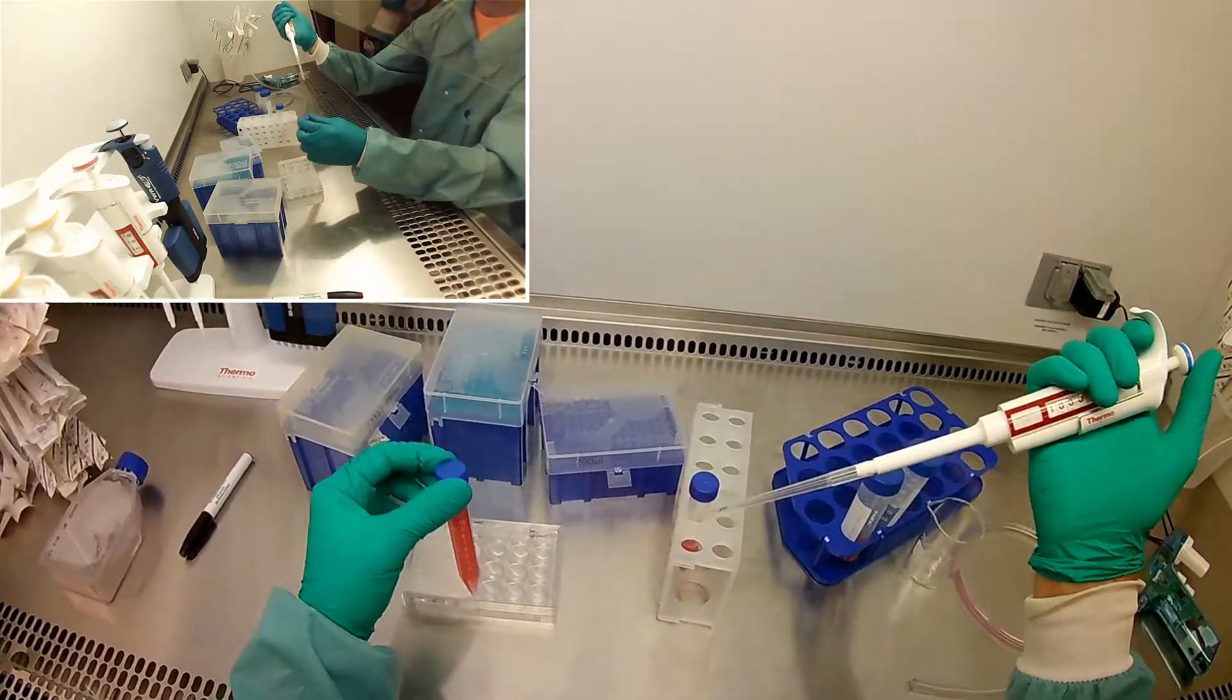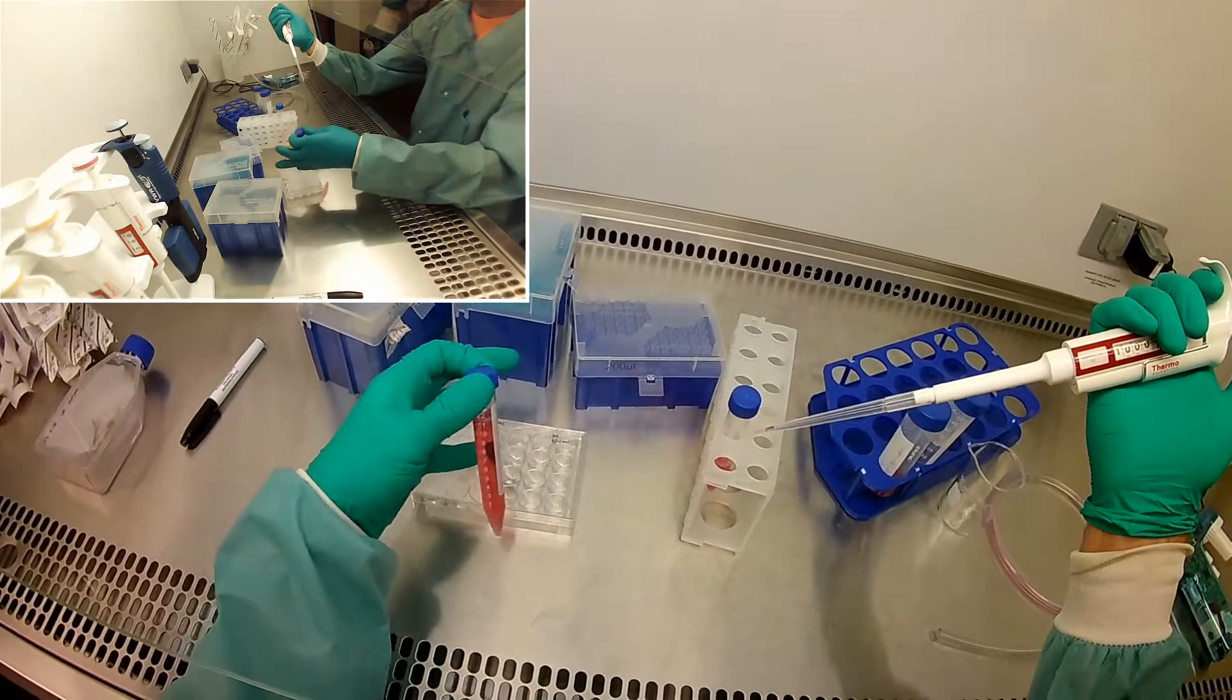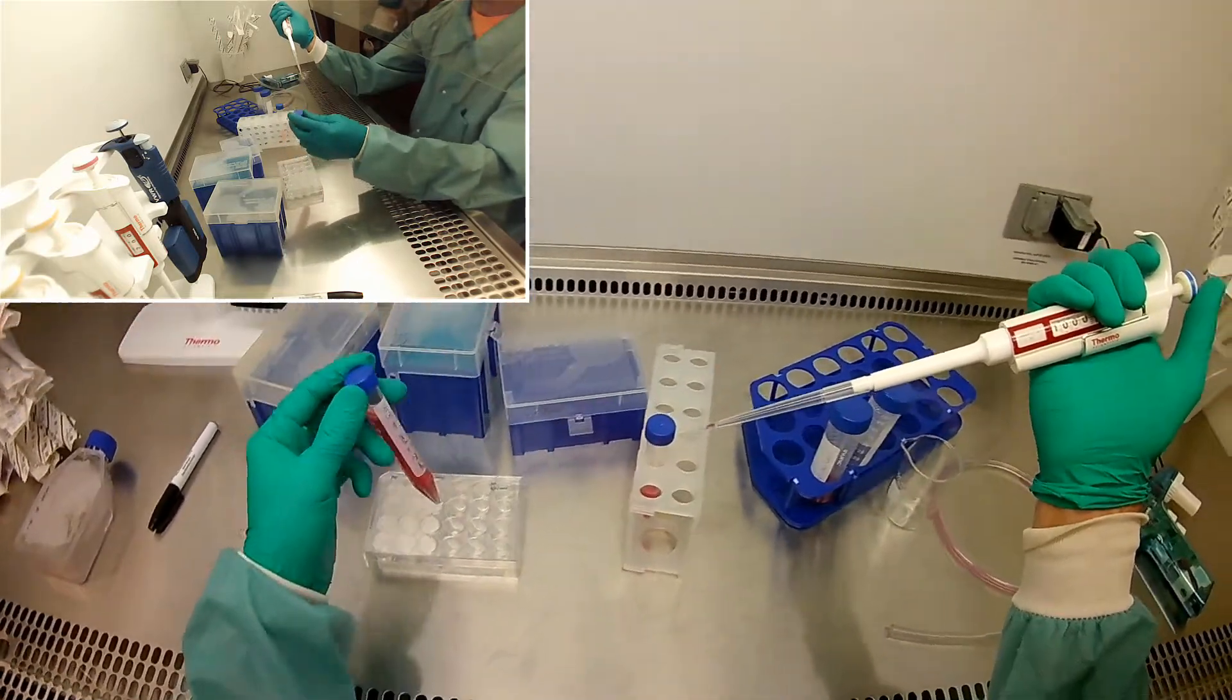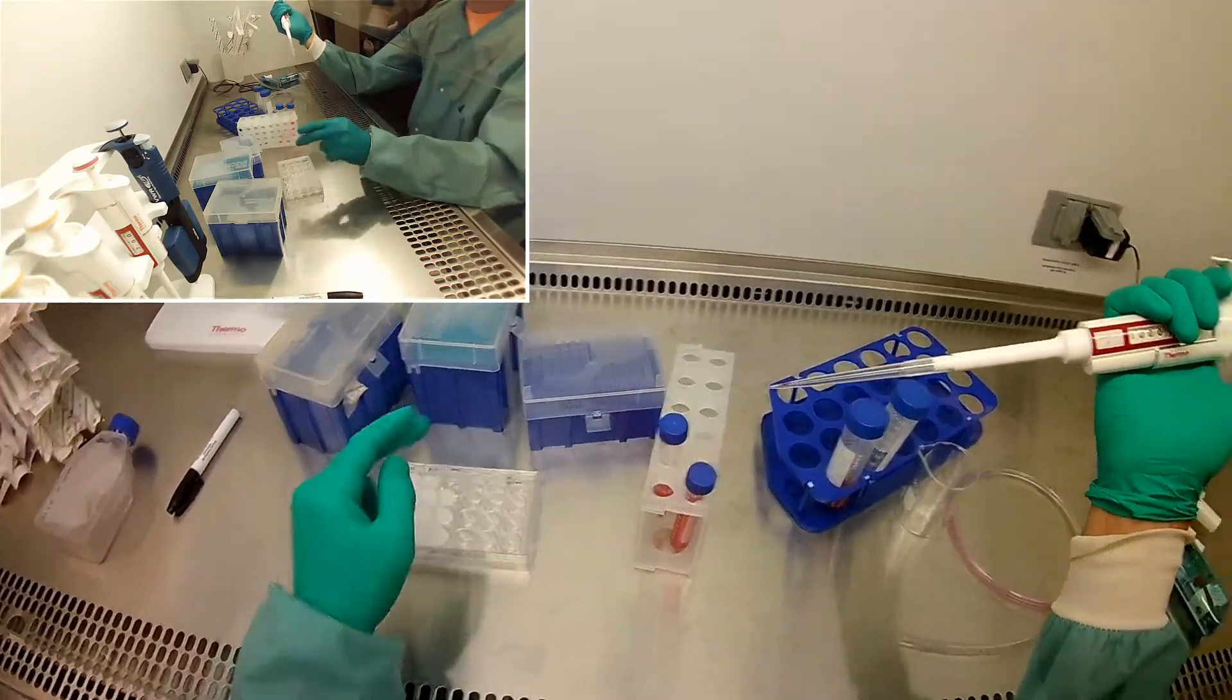Okay, so I just put the cells in there for now. I'm going to need to mix them before I put them on these gels, but I'm not quite to that point yet because I need to aspirate off all the liquid first.